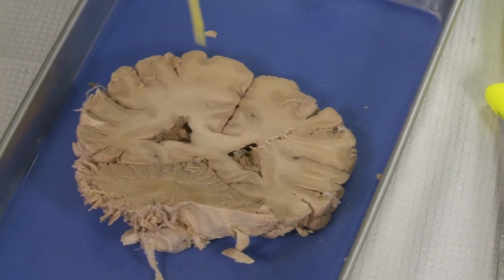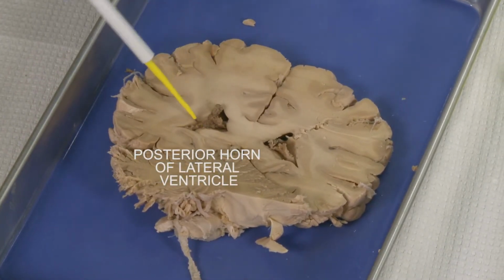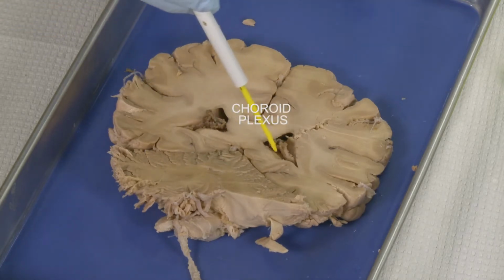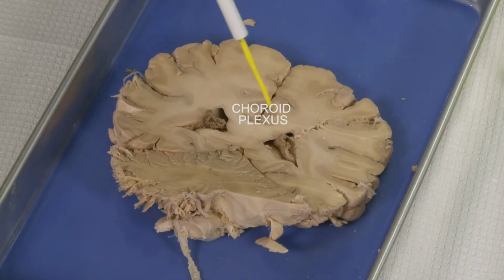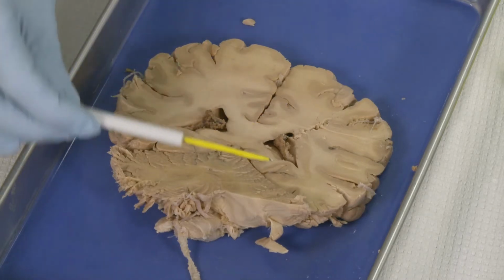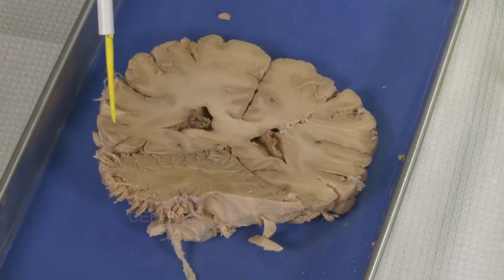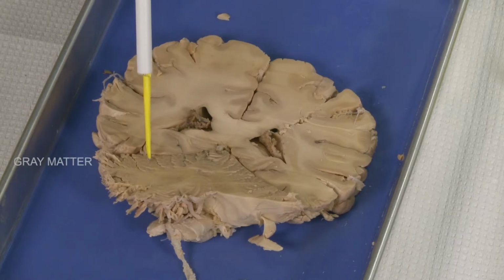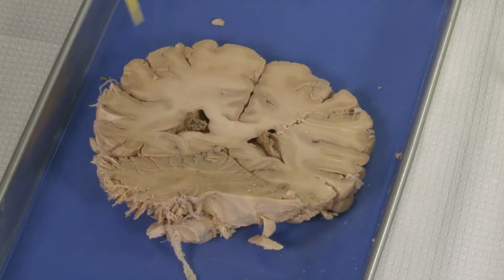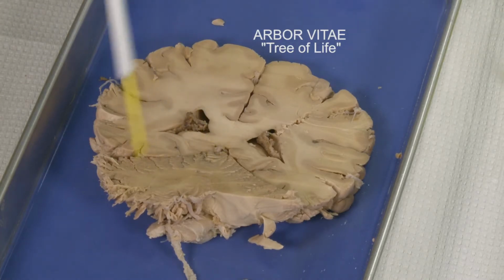Okay, what we see here is the posterior limb of the lateral ventricle, and this structure here is the choroid plexus. As I mentioned, the choroid plexus is a structure which makes cerebrospinal fluid, and we can see here the cerebellum, a section through the cerebellum. What I can point out here is the gray matter of the cerebellum and the white matter of the cerebellum. The white matter of the cerebellum is also named arbor vitae, which looks like a tree of life because it has that shape.